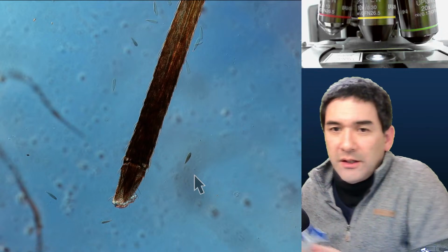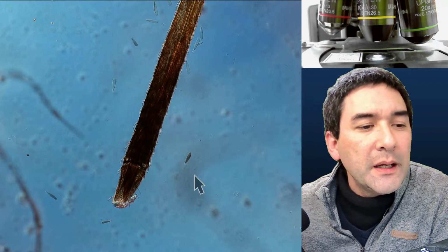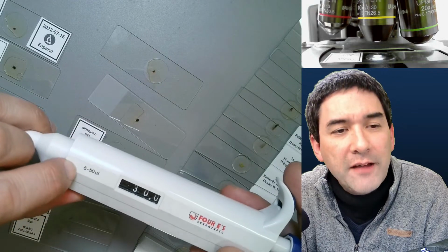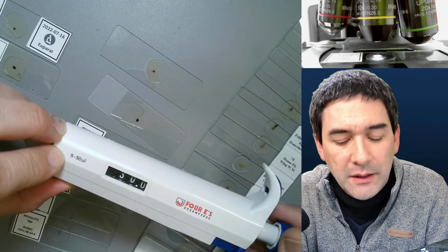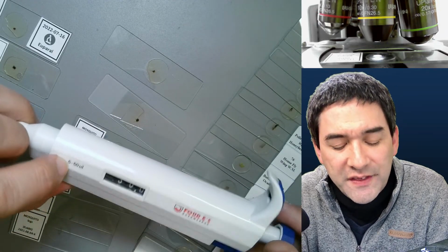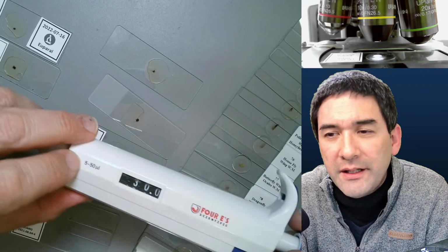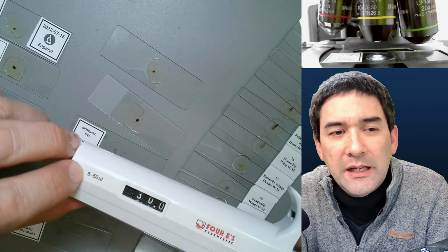Okay. So the question was about this pipette here, which I can also recommend. And this one goes from 5 microliters to 50 microliters. You can adjust it here. I've also got a bigger pipette, one that goes up to 1,000 microliters, but I found that to be a little bit too large. I think with this one over here, I was doing fine. It's a question of preference. But 2.5 microliters is a little bit small.